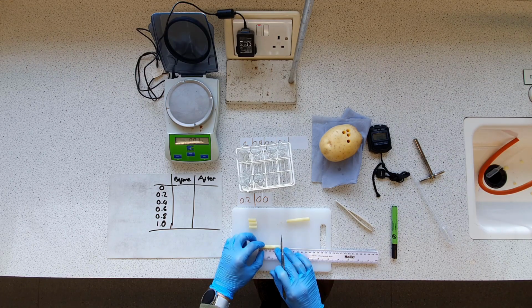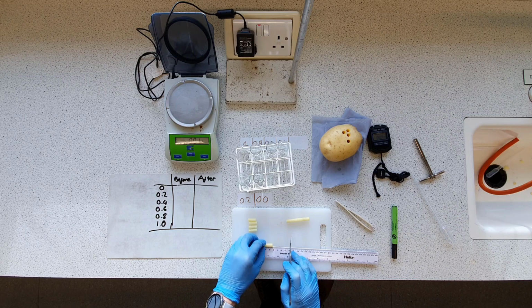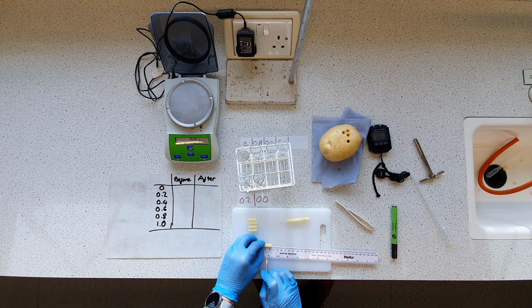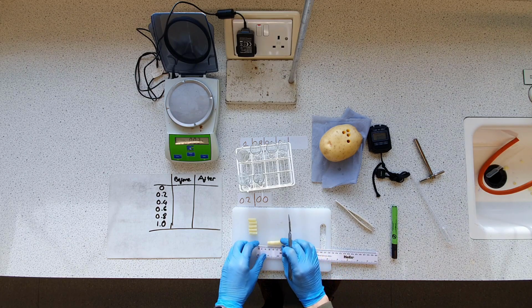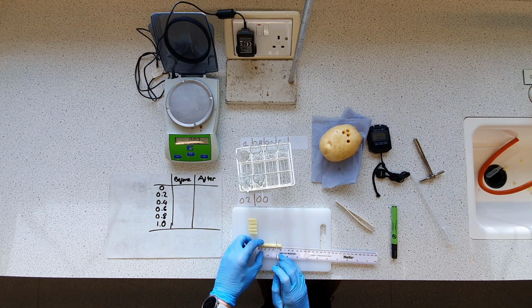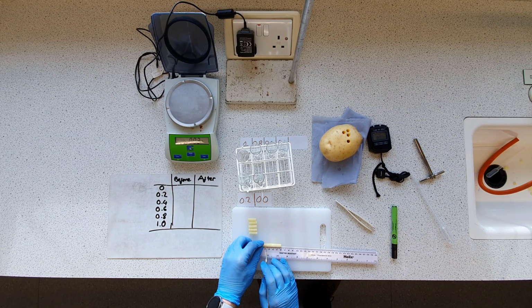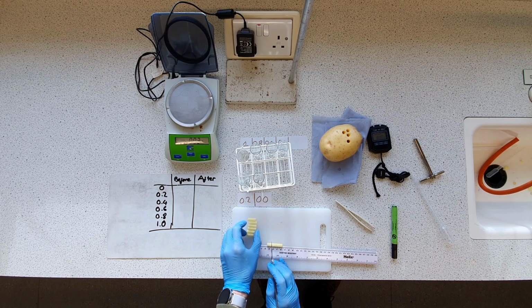It's not a perfect perpendicular cut there, so another 2 centimeters. Another 2 centimeters. And do bear in mind you are viewing this from an angle, so it might not line up perfectly from your view, but I assure you I am capable of using a ruler. At least I hope so. We'll see. Okay. So that is our 6.